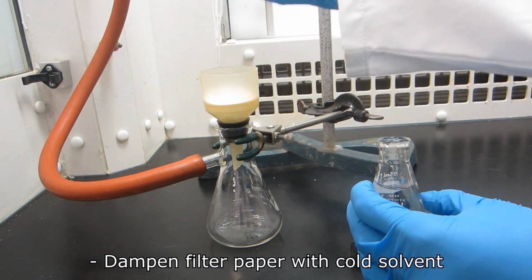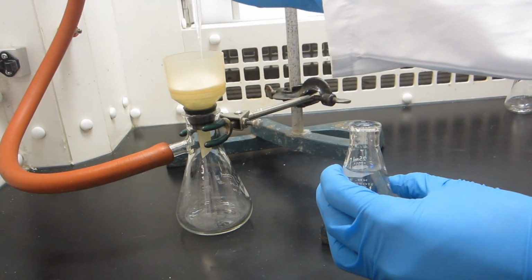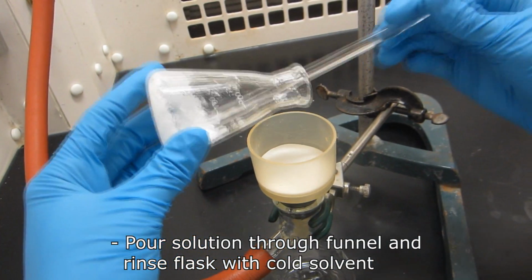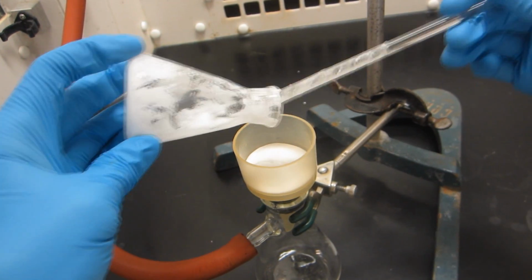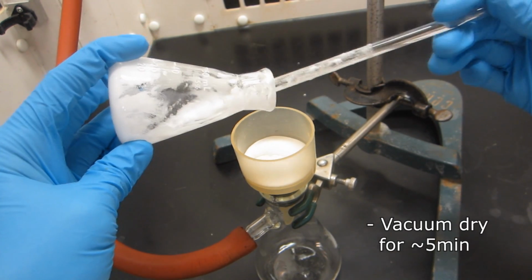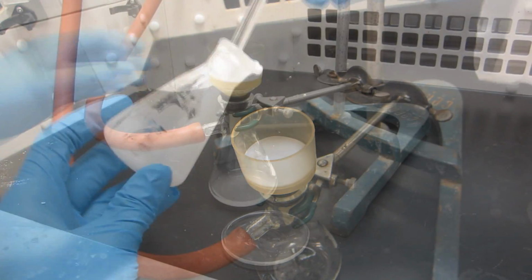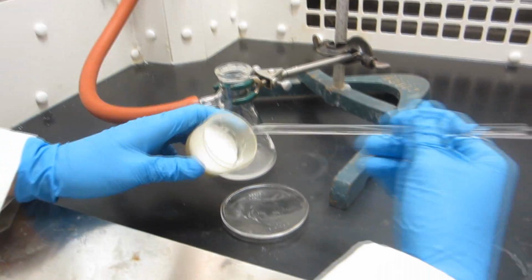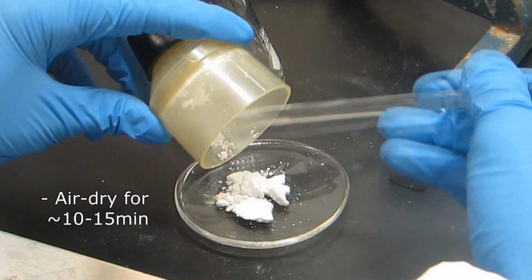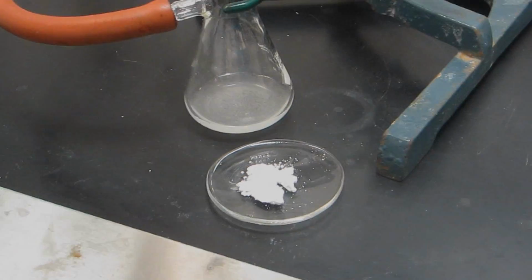Dampen the filter paper with a small volume of cold solvent to create a better seal between the filter paper and the funnel. Pour the solution containing the crystals through the funnel and rinse the flask with ice-cold solvent to transfer any remaining crystals. Allow the crystals to vacuum dry for about 5 minutes. Turn the vacuum off and transfer the crystals from the funnel onto a pre-weighed watch glass. Allow the crystals to air dry for 10 to 15 minutes. The product can now be weighed and analyzed to determine purity.